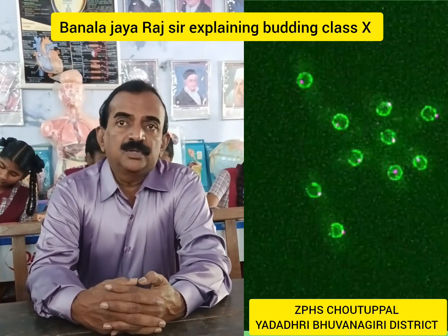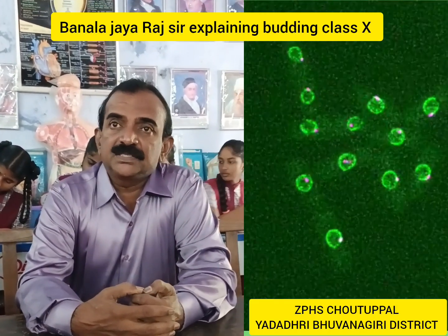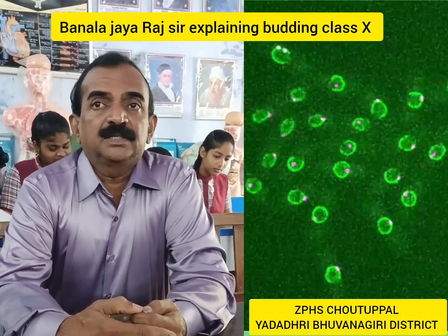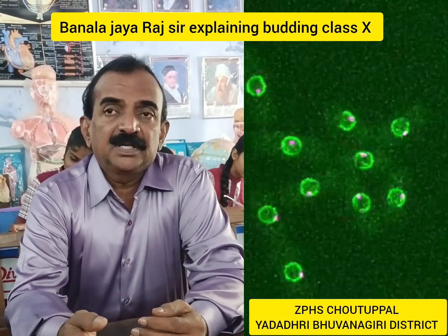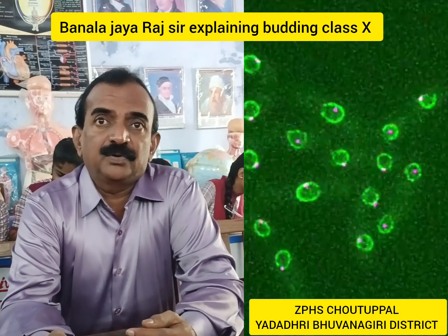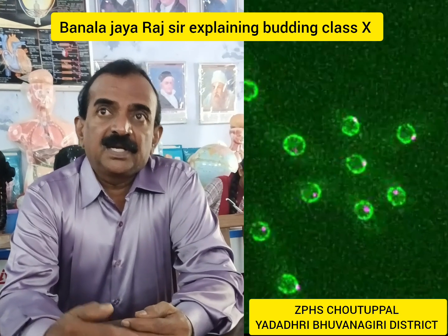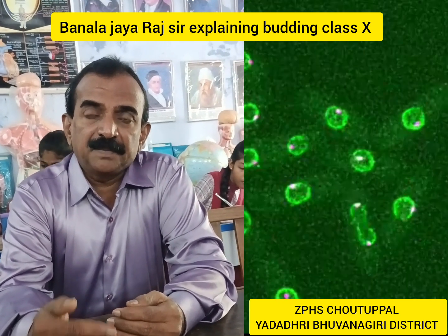In this video, you are observing a beautiful yeast cell budding — asexual reproduction. In yeast cells, a growth takes place as a bud and they grow identical to that of the parental cell. When they grow completely, they separate and live an independent life. This is budding.